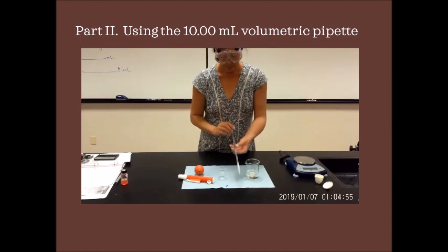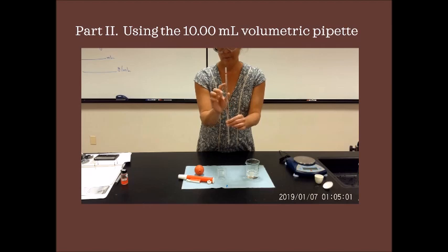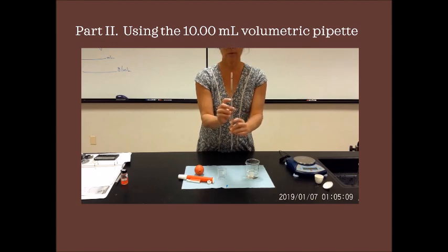Okay, with a glass pipette, it is calibrated, it goes to 1/100th of a milliliter. So the 10 actually tells you this can measure exactly 10.00 milliliters. There's only one line on here because basically you're going to get the bottom of the meniscus of your solution at this line. You can't get it above or below. It's calibrated exactly 10.00 to this line.